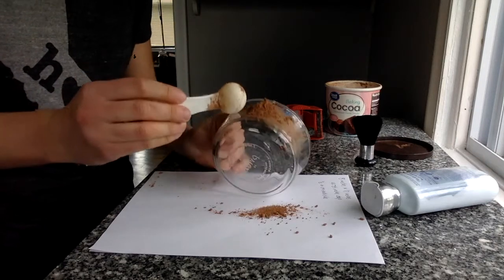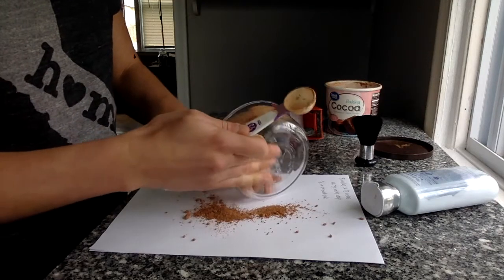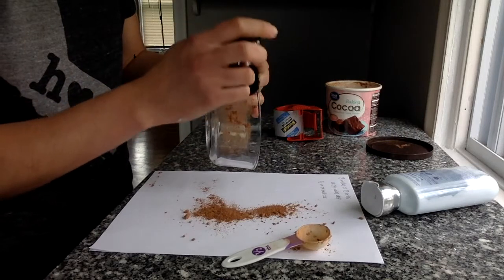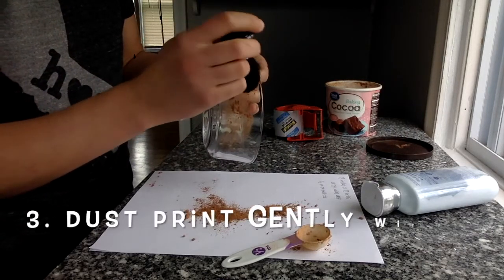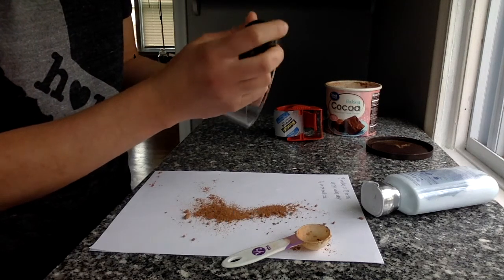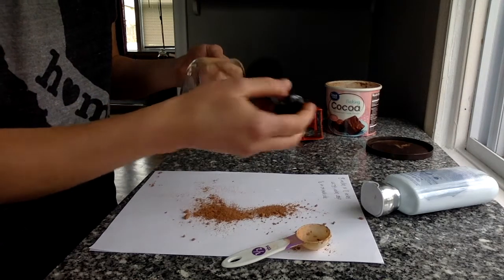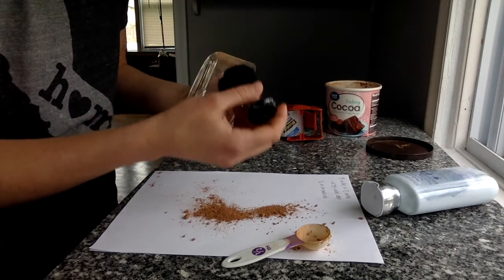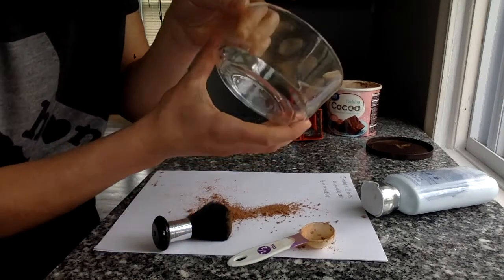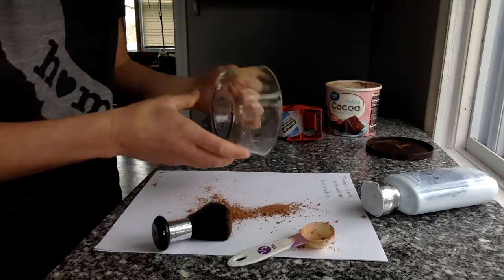Yeah, you see what I'm saying? It's so messy. Okay. So now that we've got our powder, this is where your makeup brush comes in because you're just going to kind of real gently dust the extra powder off. And you want to try to do it without destroying the fingerprint that's underneath. And I don't know if you guys can see that, but in the light, we've got some cocoa powder kind of sticking to that residue.